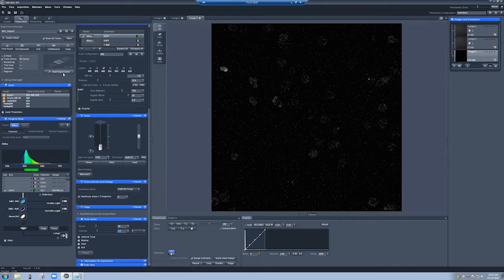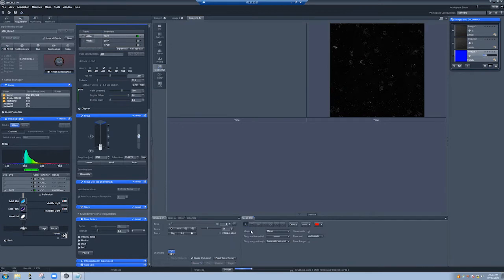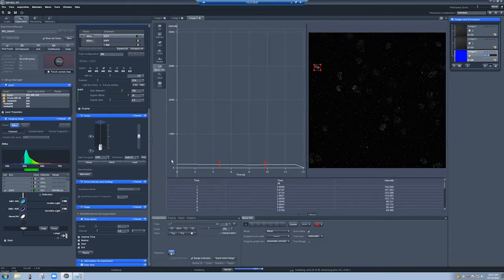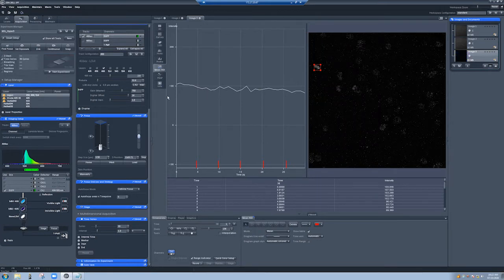So I'm going to go to start experiment, going back to range indicator. And now what I'm going to do is go to mean ROI and draw something here. I'm going to change this, and then I'm going to just stretch this out a little bit, just zoom in so we can see. These red things are where the definite focus acted. And so you can see there's a very slight trend going down. It's not terrible. But what if we increase the laser power to, let's say, 20%?